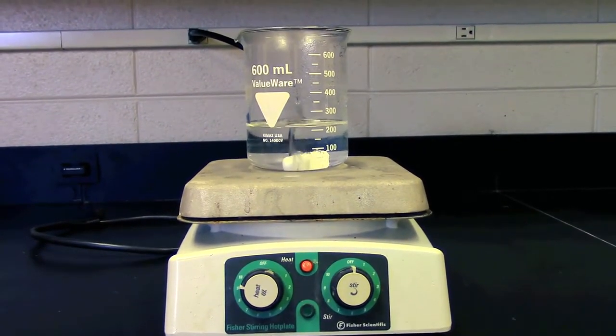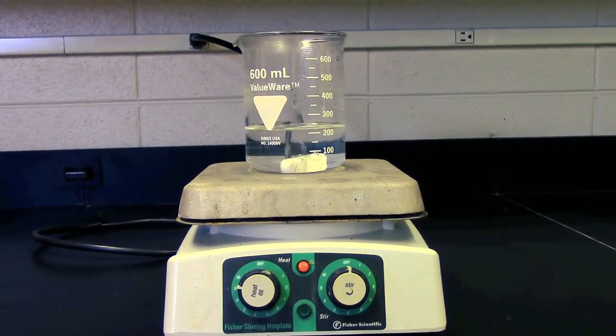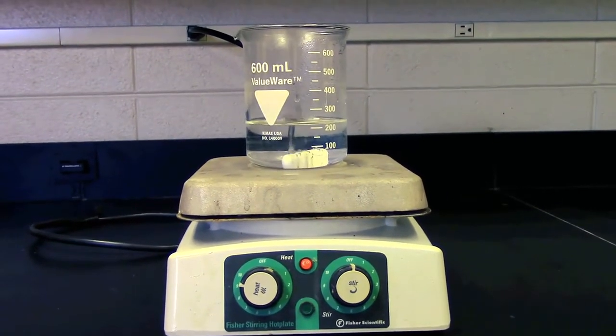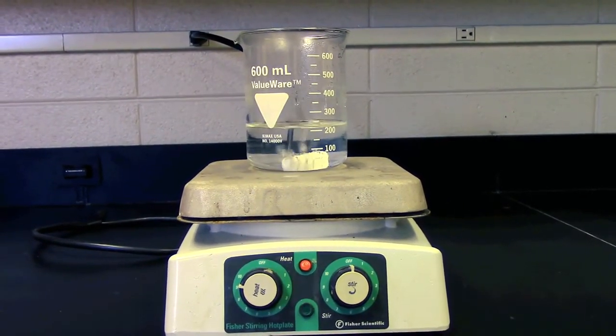Before turning the machine on, be sure to look at the labels on the buttons. Sometimes there is an option to turn on the heat, which for this experiment will prove to be very helpful.